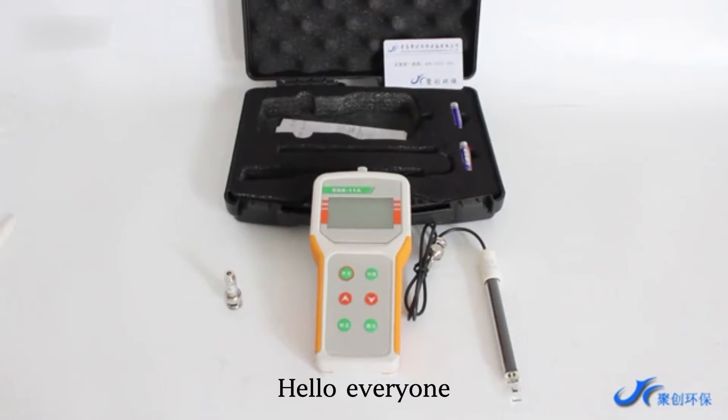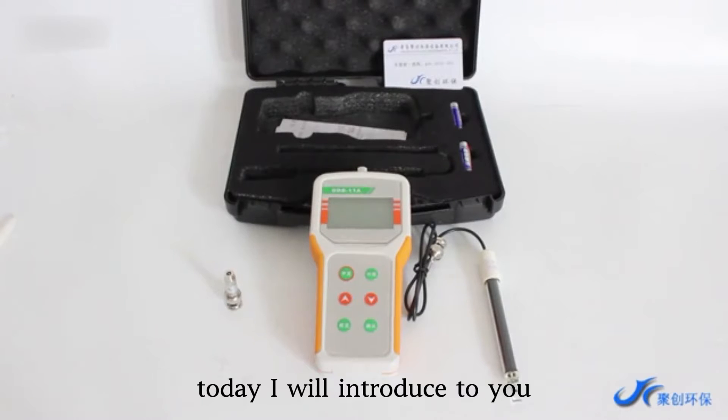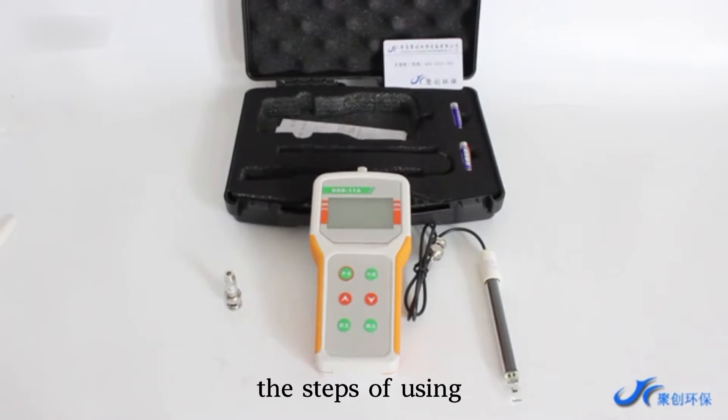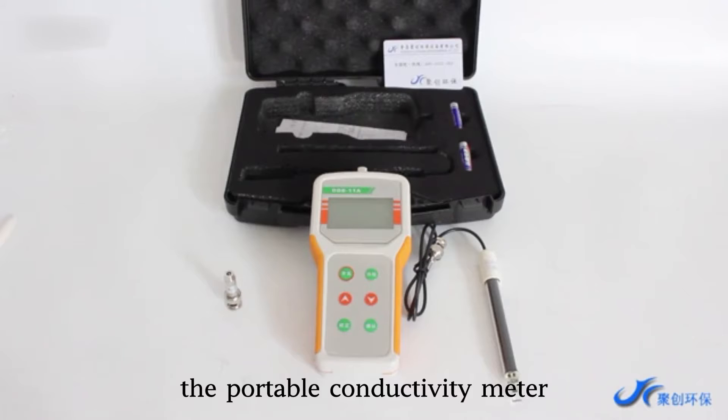Hello everyone, today I will introduce to you the steps of using the portable conductivity meter.